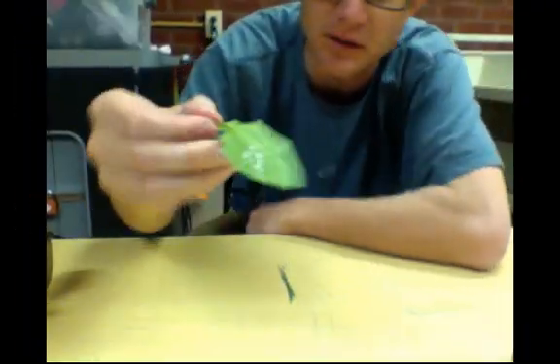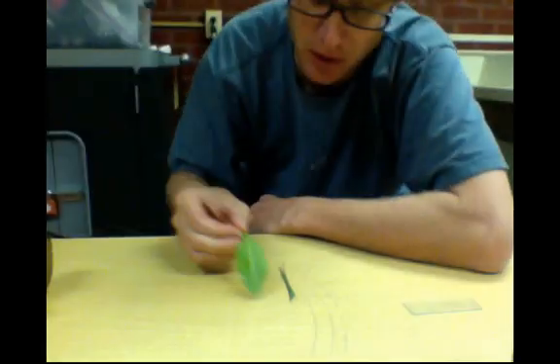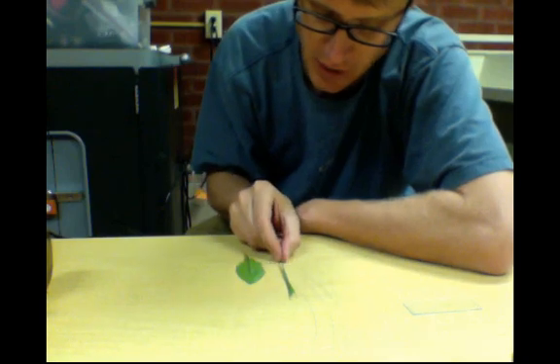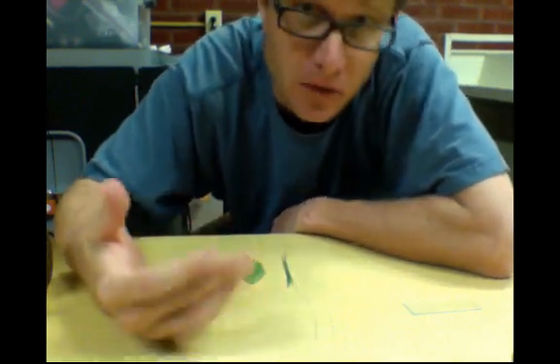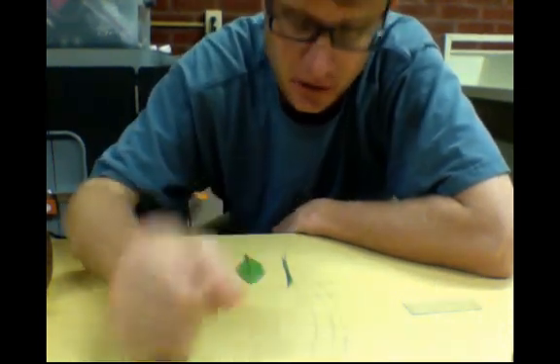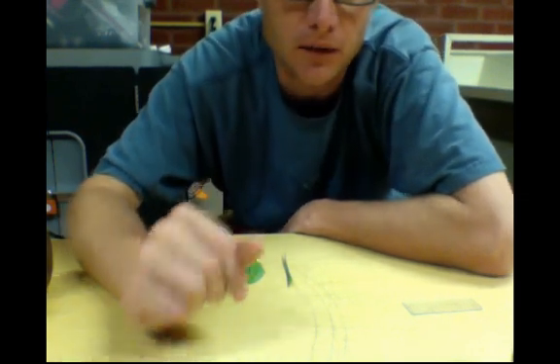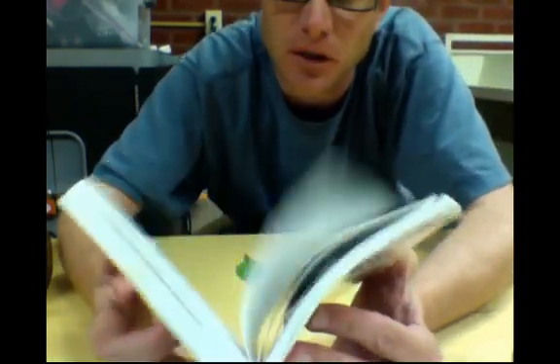And now you simply want to let it dry. I've painted on the underside of the leaf, and now I want to let it completely dry. What I'm doing is I'm getting that fingernail polish to adhere to the epidermis or the top layer on the leaf. And then I'll be able to pull it off. So this takes a little while and I'm just going to sit back and read and maybe speed up the video a little bit.